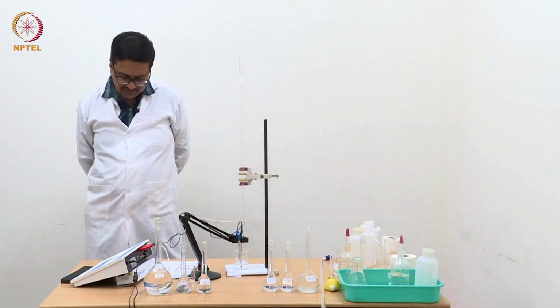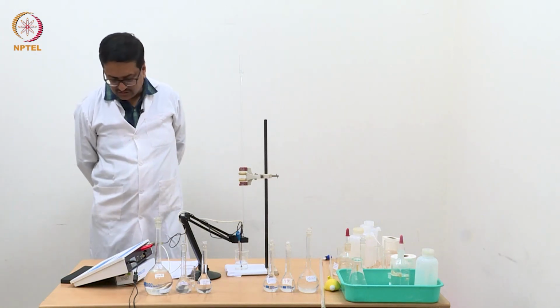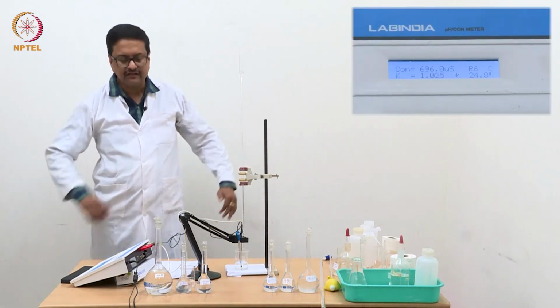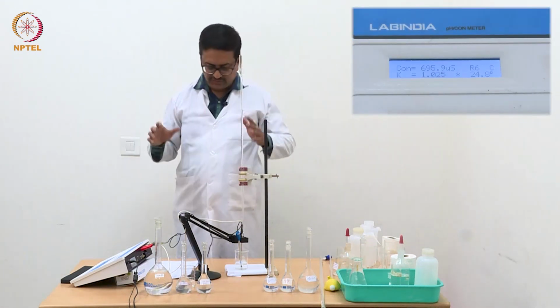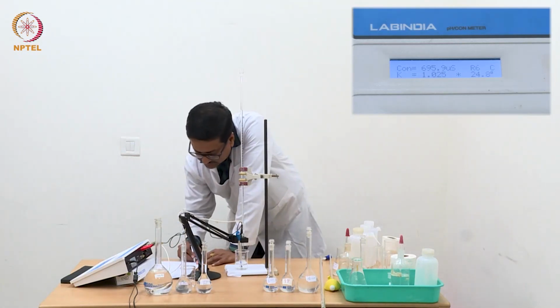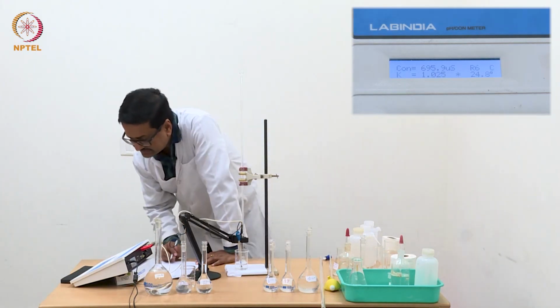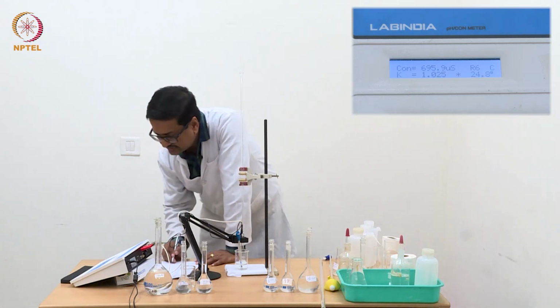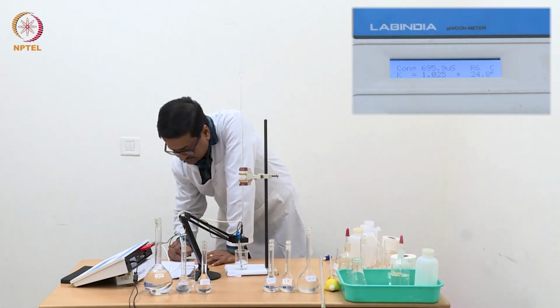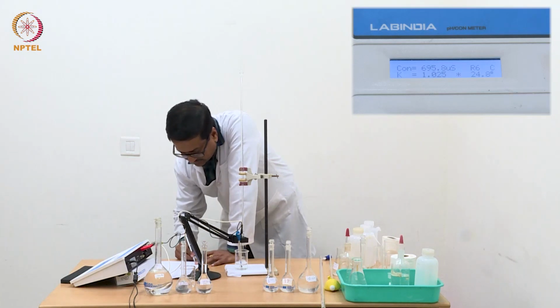So now we see that we are reaching a little more than 688, 695, 697, which is about 40 to 50 microsiemens increase from the previous value. So these are within the experimental error limits. 695.9 is 696. So this will be our end point for this triple mixture versus NaOH titration.